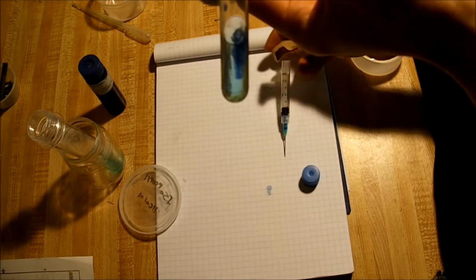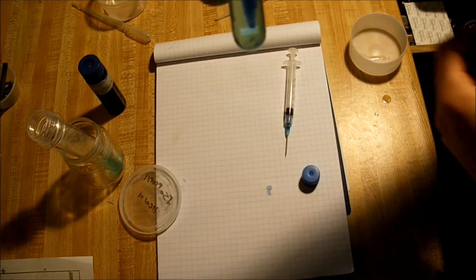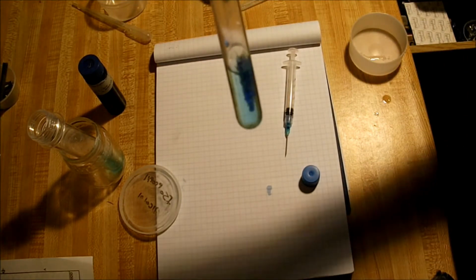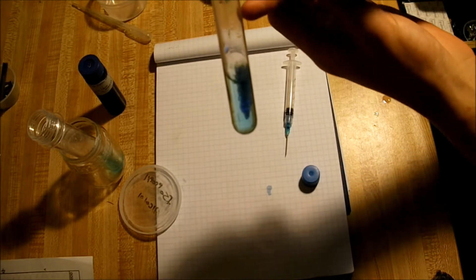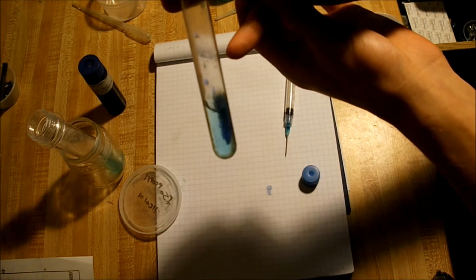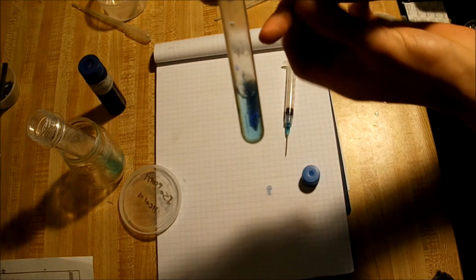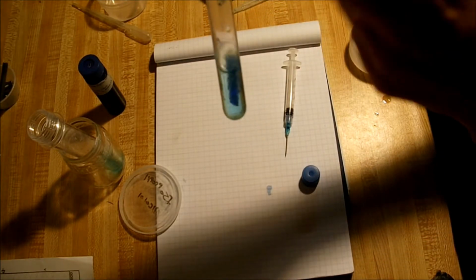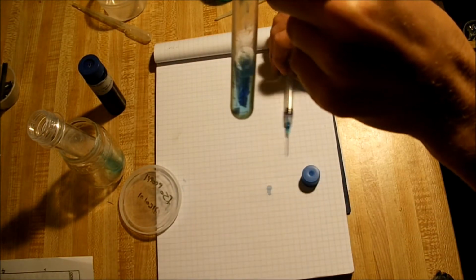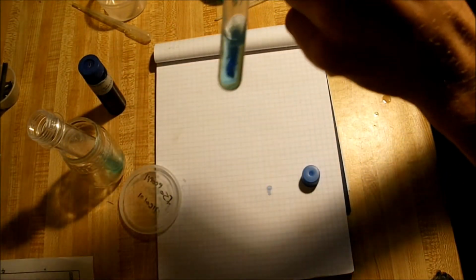And what happens is the copper sulfate reacts with the TACS to make the trail more visible, and then the alcohol precipitates the TACS and the reacted copper sulfate to make visible trails that seem to linger in the solution. Do one more here.